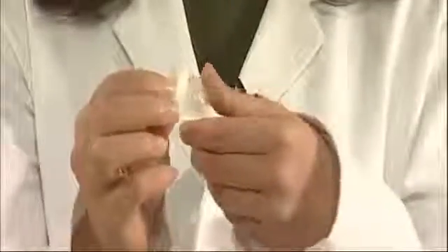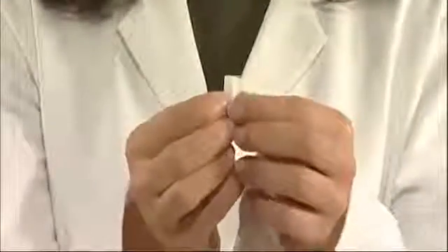Ampicillin and arabinose are rehydrated using a transfer pipette. These are sterile and individually wrapped. Open them at the bulb end, where the paper and plastic are split.